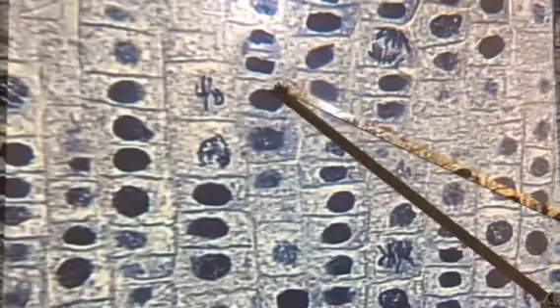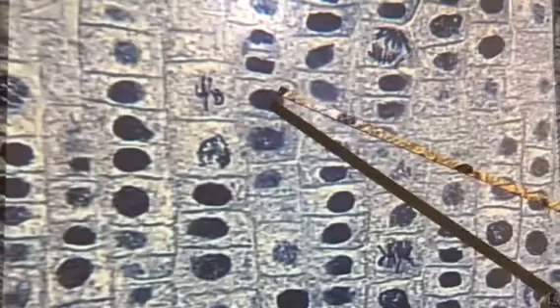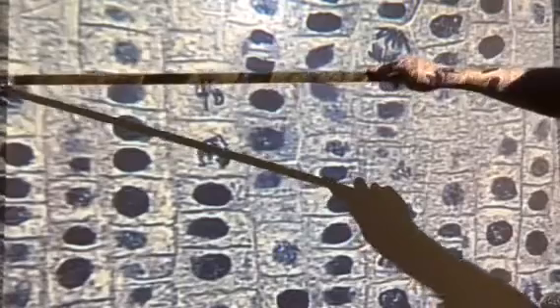So the first thing it's going to do is get its chromosomes ready, which is going to take all this unwound DNA and wind it up. So I'm looking around here for a cell where I can start to see chromosomes. And my eye comes right there. This is a good one of what prophase is going to look like. This one I would call a prophase right there as well. This one right here would be classified as a prophase. If we can see over here, that's a prophase too.